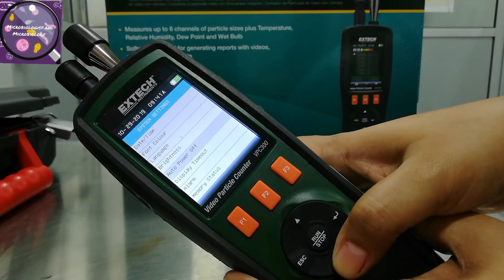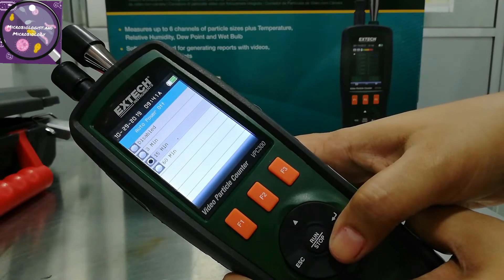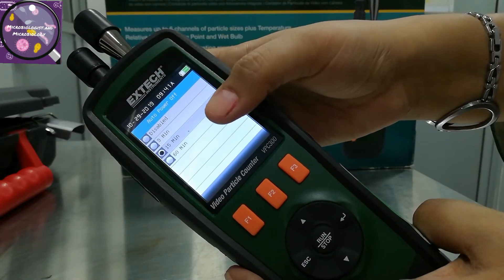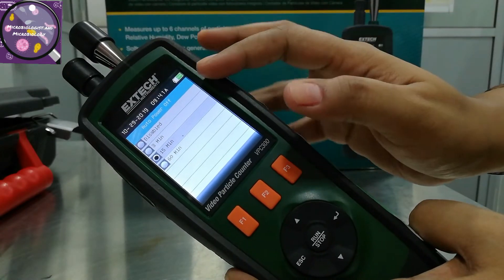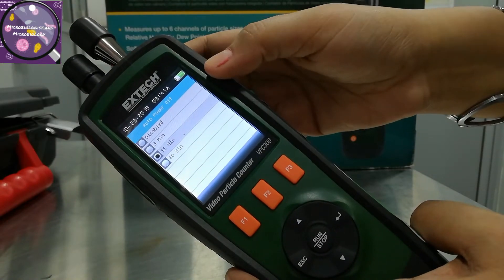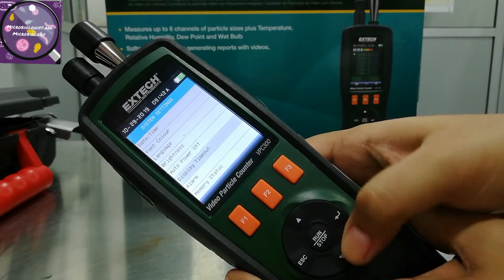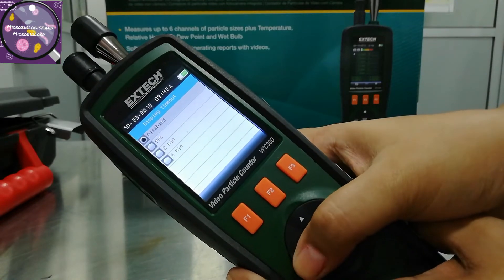Here is the auto power-off setting — if we are not working with the particle counter, it will turn off by itself. We can disable it or select three minutes, 15 minutes, or 60 minutes. And this one is the display timeout.